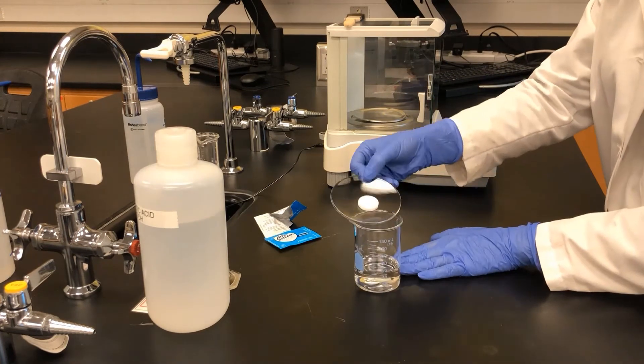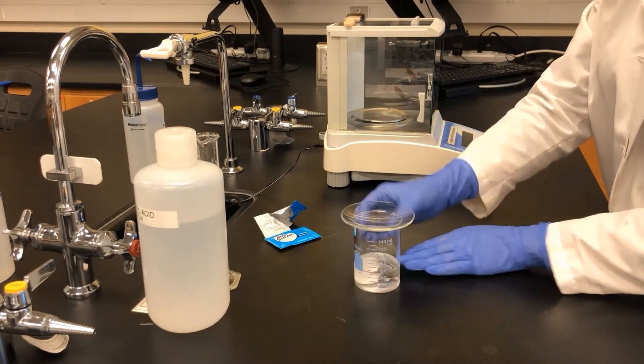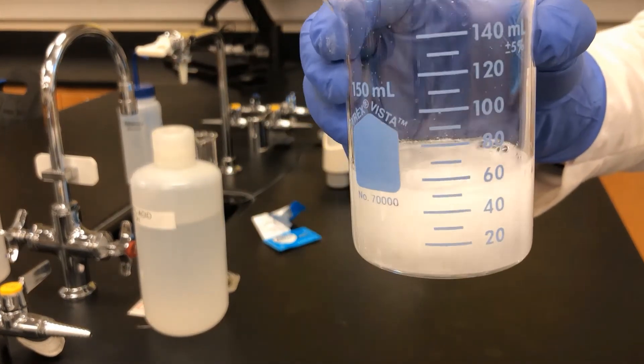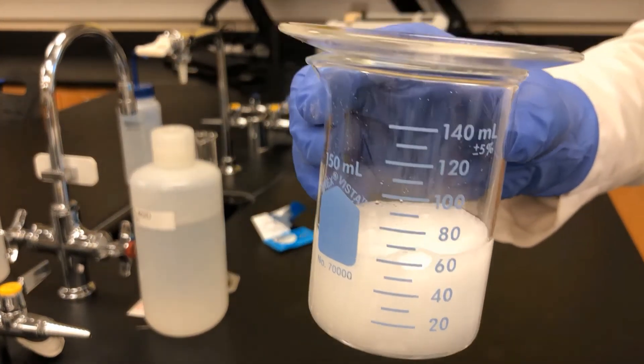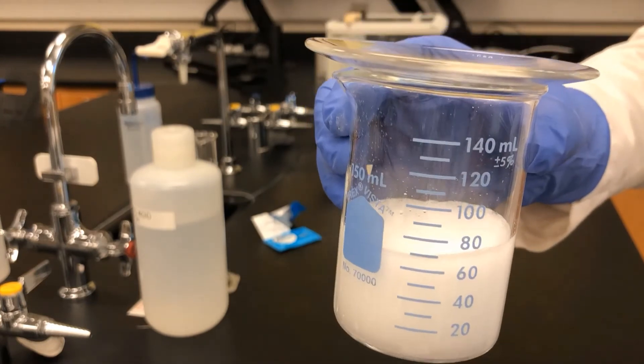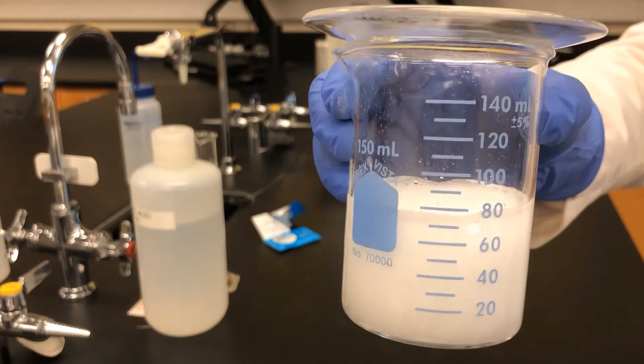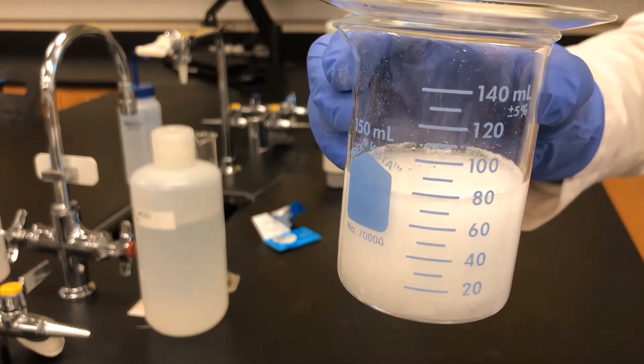The antacid tablet is carefully added to the beaker of acid and a chemical reaction occurs. What gas do you think is forming? What is inside those bubbles?